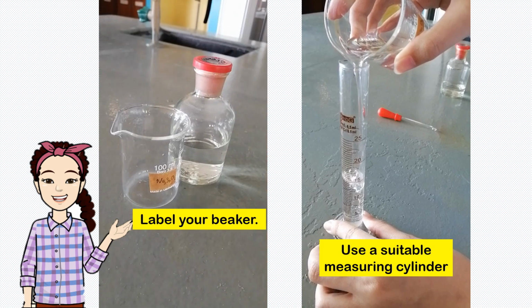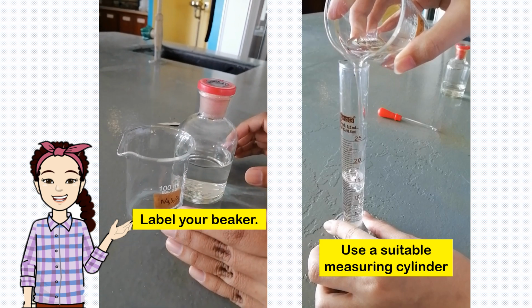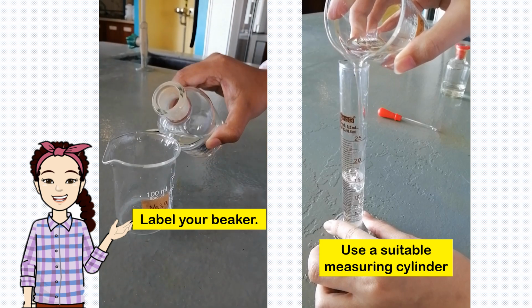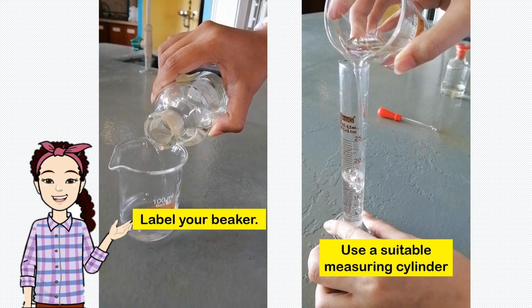Okay, now let's get ready for your experiment. First, don't forget to label your beaker. Then, pour some sufficient amount of sodium thiosulfate into the beaker.